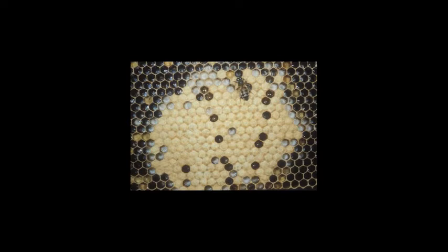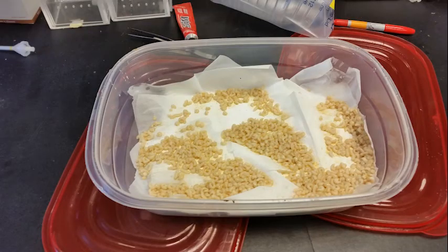They still were going to get fed probably one more time before they were capped. And so instead of putting them in with bees, we just place them into a tub face down, the frame on its face, and we put them in an incubator with the right temperature and humidity. Now, the larvae, once they start to get hungry and no worker comes to feed them, they appear to still have this instinct to search for food, and they'll crawl out of the cells and they'll fall out.